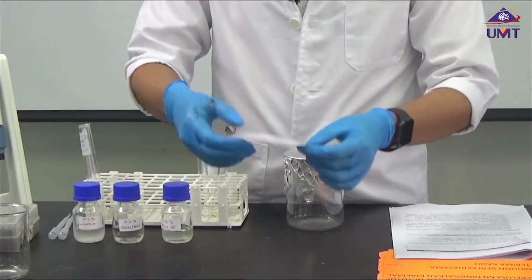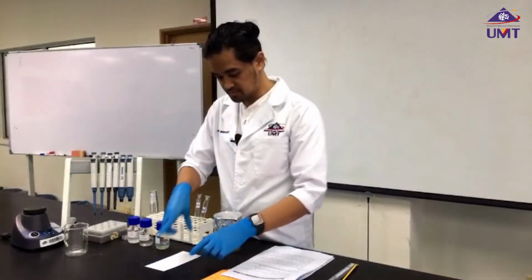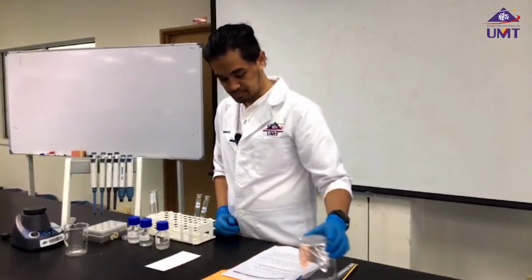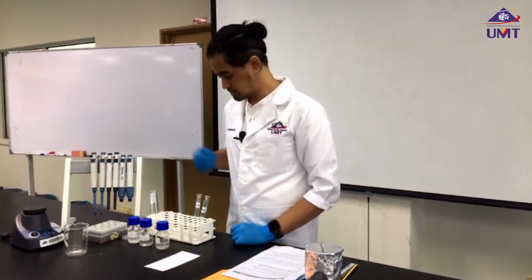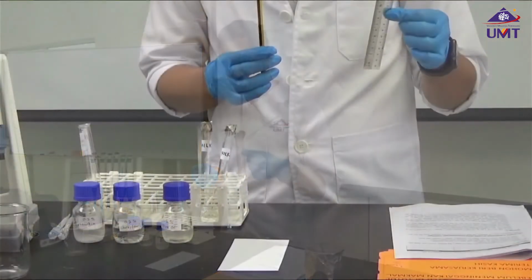All right? So now we need to label our TLC paper. Use pencil and ruler.